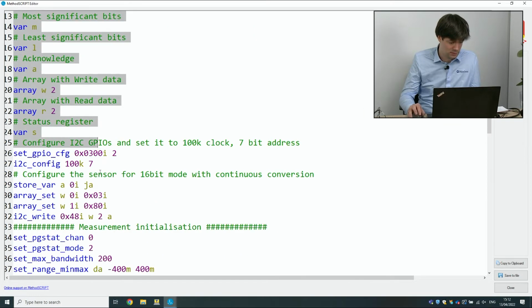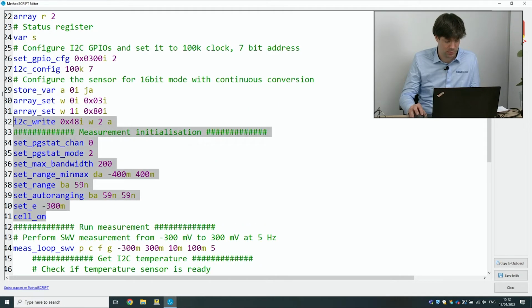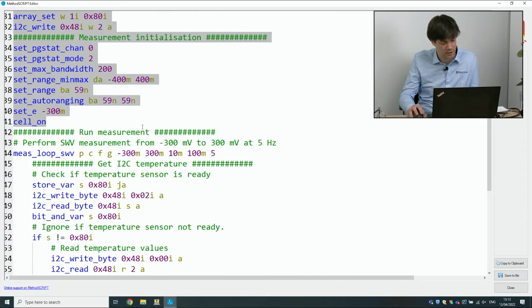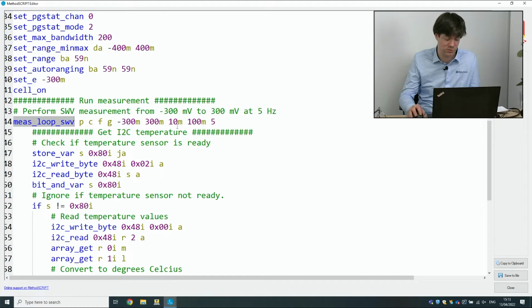The first bit here is just initialization. I'm just going to skip over this just because it's a lot of code and it's not that interesting to explain right now. Most of this is generated by PSTrace. This is the interesting bit here. This is the measurement we're actually doing.